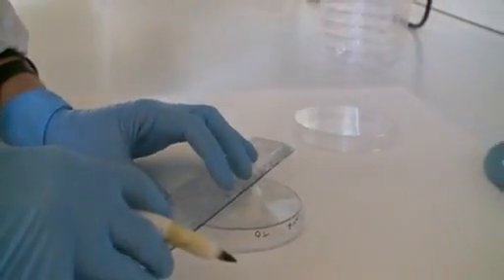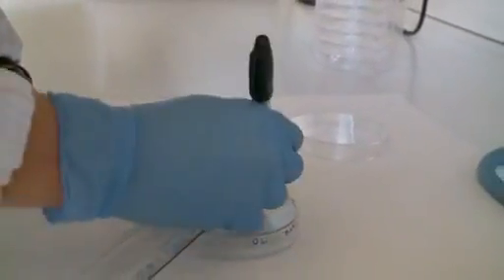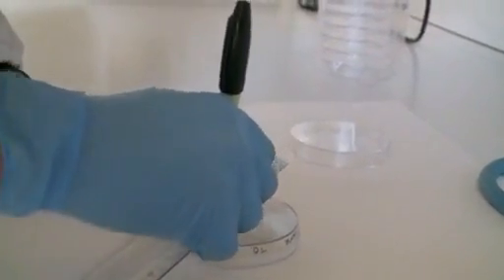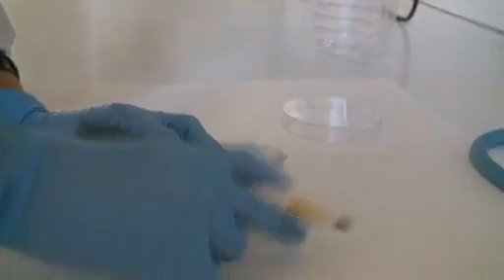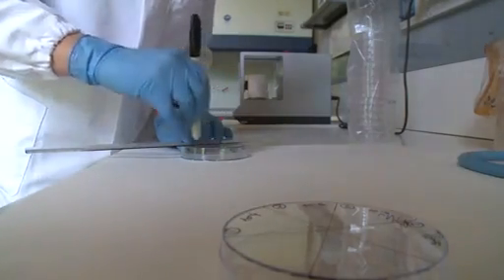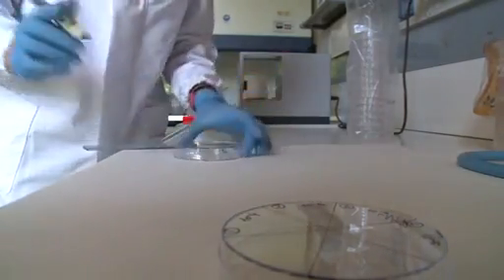Minimum two plates for each test concentration are required including control. Minimum two plates for the test concentration and exposure time.